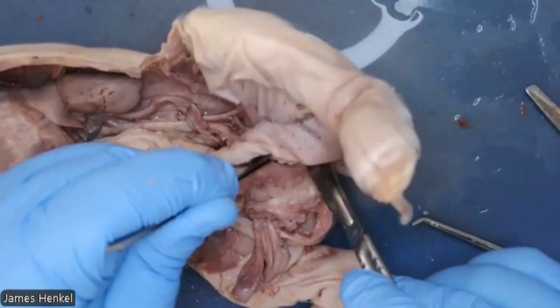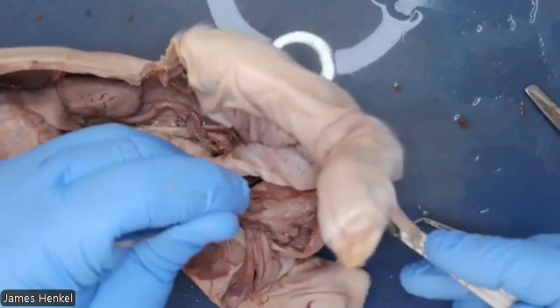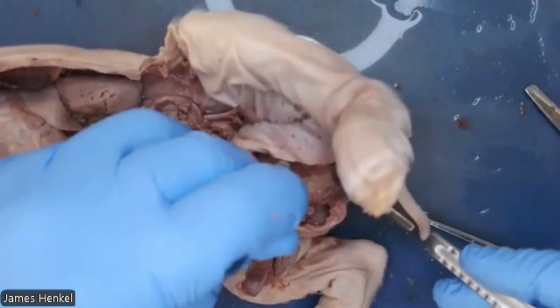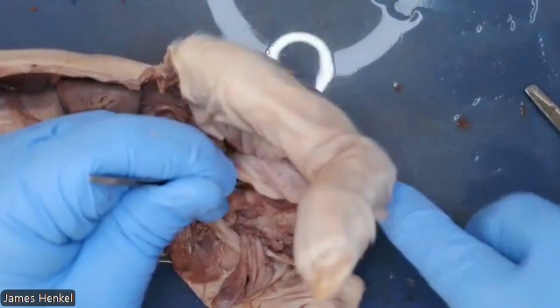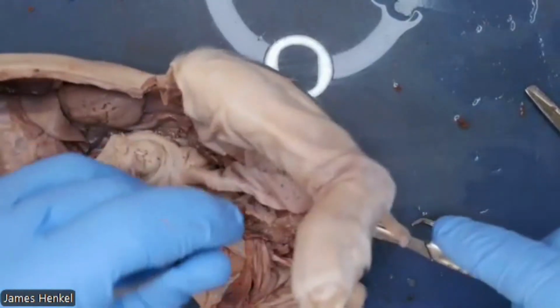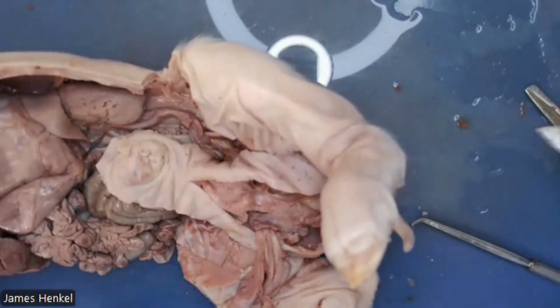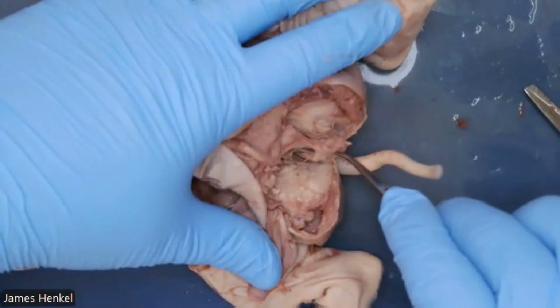And I'm lifting it up with the forceps, the part of the pelvis that I've cut free, and I'm cutting parallel with this without cutting the stuff underneath. So I'm keeping it horizontal with my cutting instead of vertical. Then I can cut all the connective tissue, keeping the pelvis in, and then remove that part of the pelvis. Okay, so I've removed that.